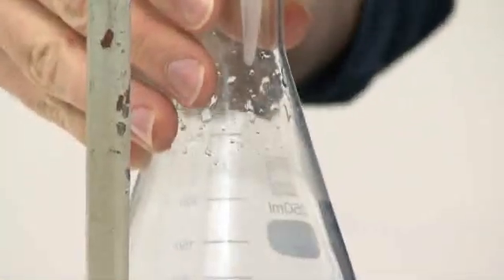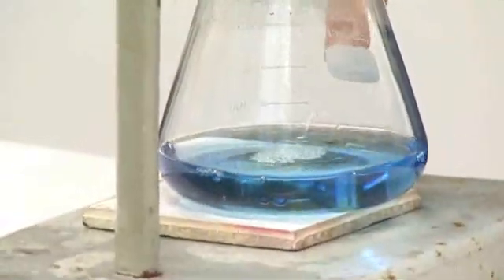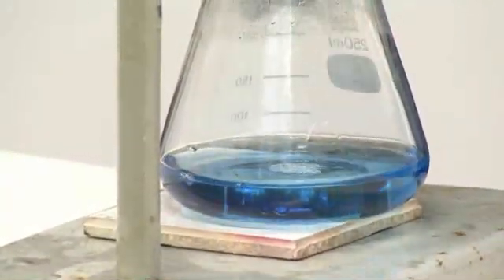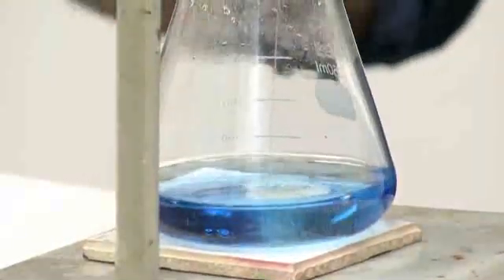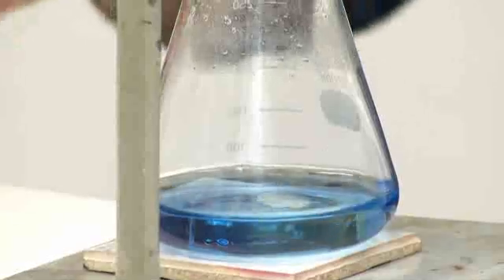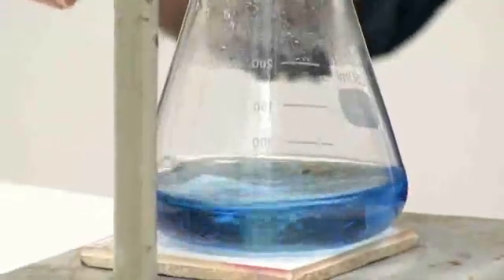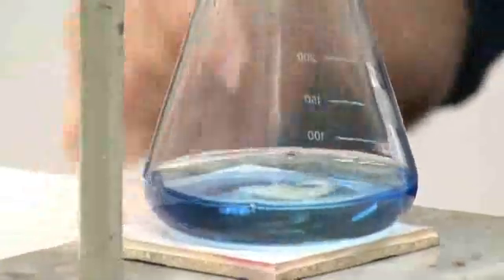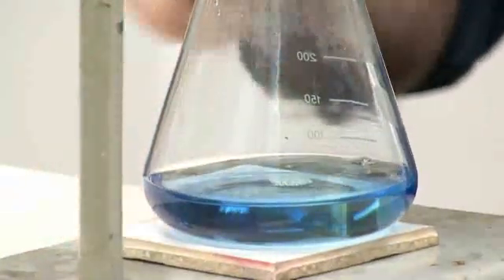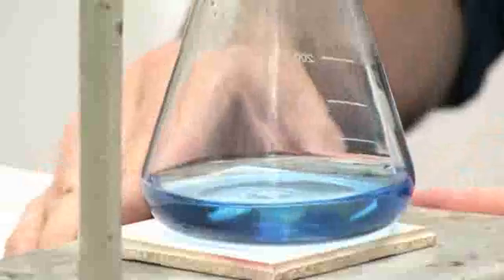I've put in about 17 mils. I have a look. Can you just confirm the middle is yellow? Can you see that? I'll give it a swirl. It disappears. It means we're close to the end point, and the end point is roughly the same as the equivalence point. Can you see the yellow in there? The swirl, it disappears. So add more. Let me see the yellow. So add some. See it turned yellow in the middle? So we're getting closer and closer to the equivalence point.